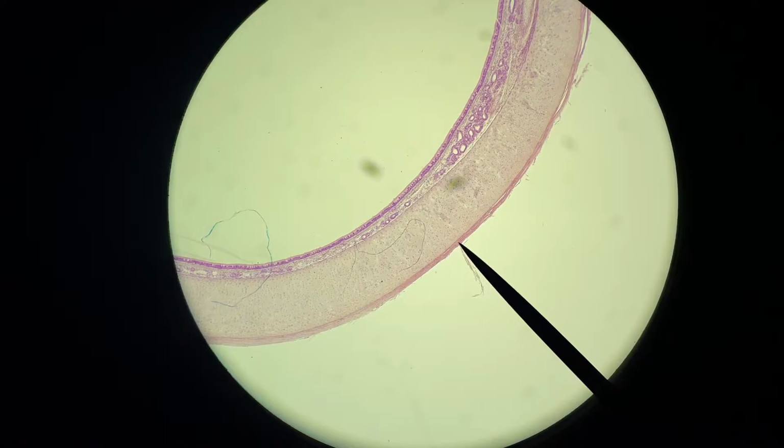Okay, so here's our tissue sample. And this is actually taken from a cat trachea. So their trachea is constructed much like ours. It has hyaline cartilage, smooth muscle, areolar connective tissue, and pseudostratified columnar epithelium. That last mentioned, pseudostratified columnar epithelium, that's the tissue we want to see.